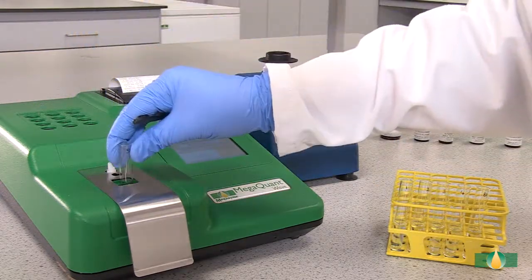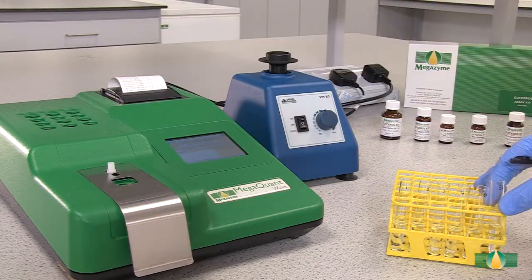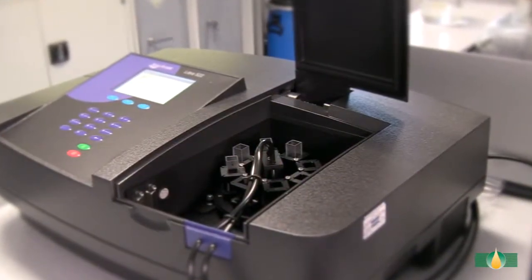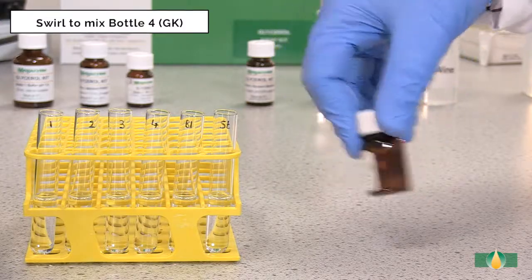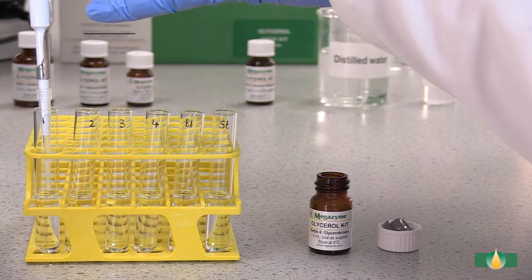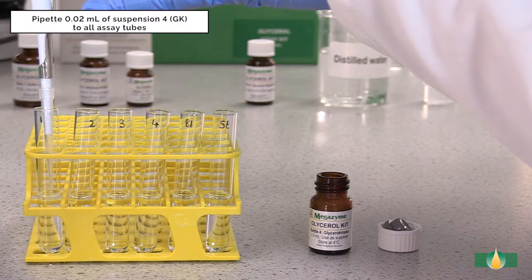In this demonstration, we are using the Megaquant Wave spectrophotometer, set to read at 340 nanometers. Alternatively, a recording spectrophotometer with 1 cm path length cuvettes can be used. Swirl to mix the contents of bottle 4 prior to dispensing. After recording the A1 absorbance value, pipette 20 microliters of the trigger enzyme, glycerol kinase, into all assay tubes.